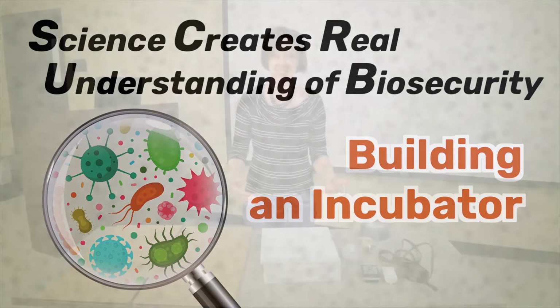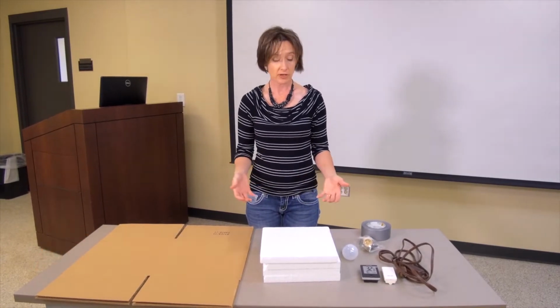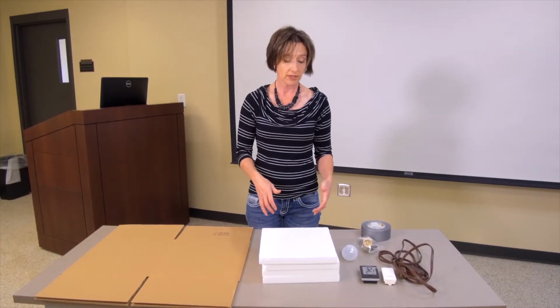For Activity C in the Cleaning and Disinfectant curriculum, part of Scrub, you'll need an incubator. So you can buy a commercial incubator, or you can actually make one from scratch with some pretty simple materials. So I'm going to show you how to make your own incubator.